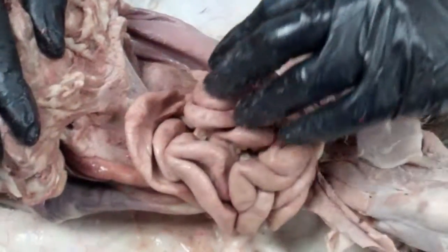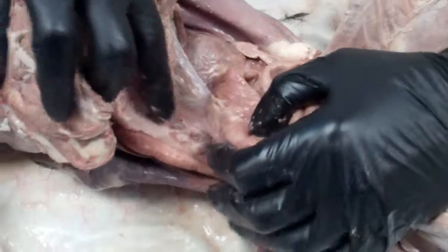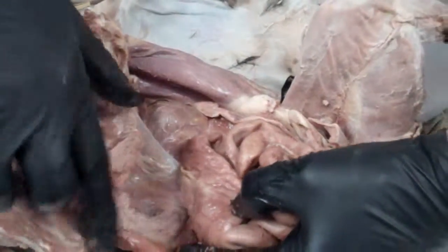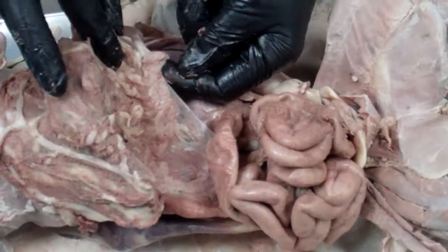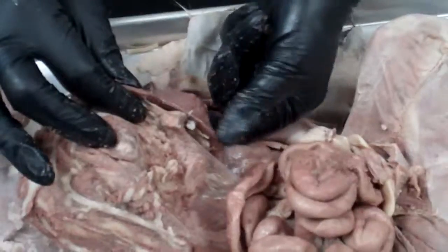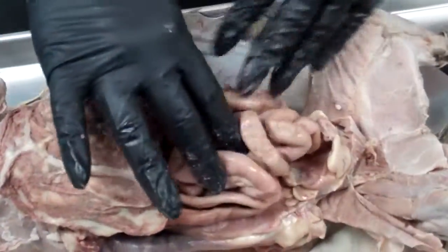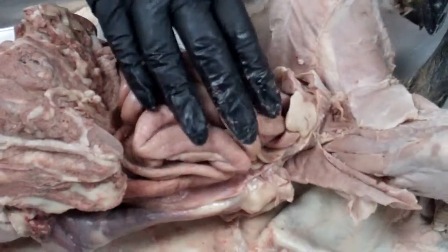And so when we do that, we're going to pull down all of the intestines. And we're going to look inside here. We're going to see a structure which again has a texture of the peas. So this structure is the pancreas. It runs all along here, then goes all the way across. This little structure at the end here is called the tail of the pancreas, and it ends right over by the spleen. So this is the spleen, tail of the pancreas, goes all along there. And then on top of this, these are all the intestines, and the small intestines are on top.